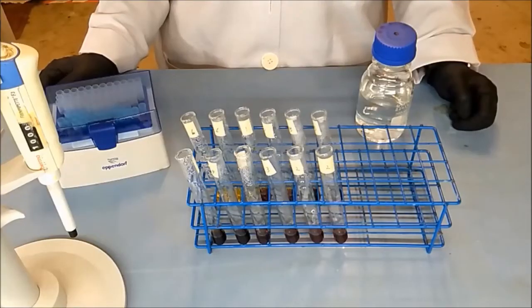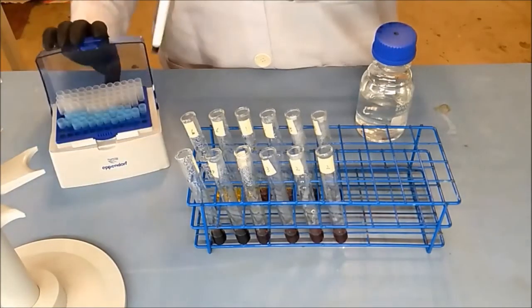After all the samples have cooled down, add one mL of Rochelle salt into each test tube.